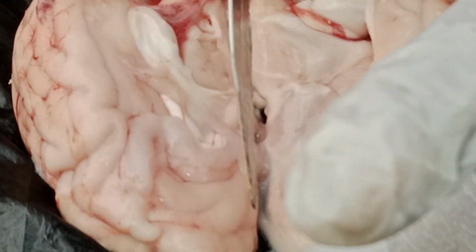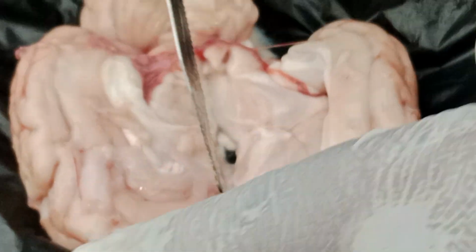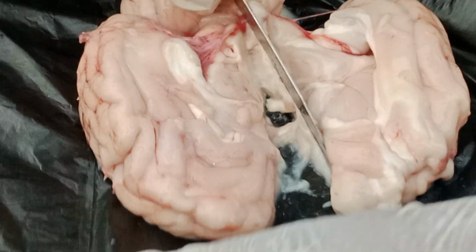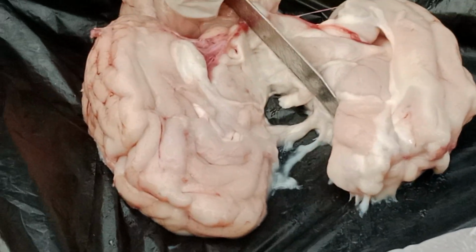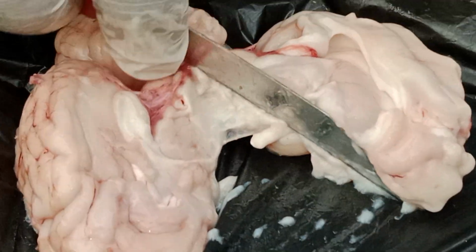So you can see my hand is somewhat shivering. Understand? Let me keep this aside, because this half we don't want now.